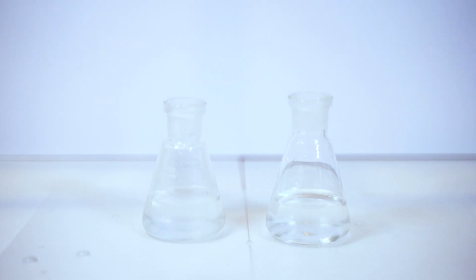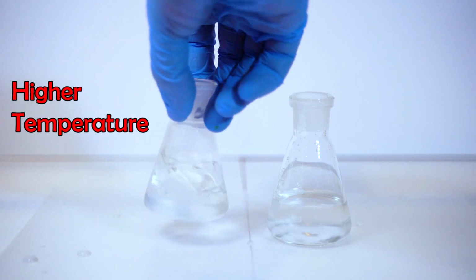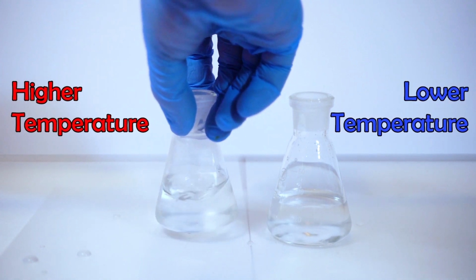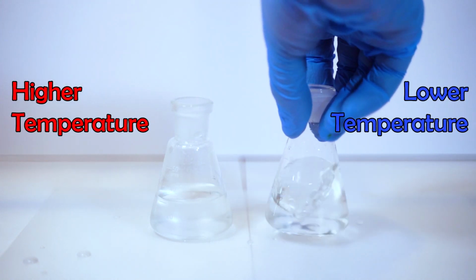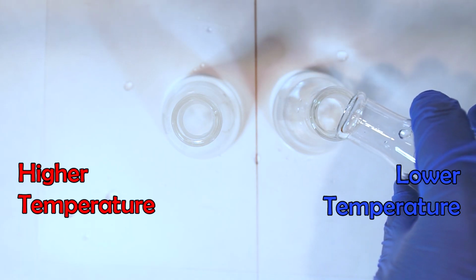So let's test it. Here we have two flasks with the exact same proportions of the exact same chemicals. The only difference here is that the left one is at a higher temperature than the right one. So I want you to predict which one will change colors first. Now let's see what happens.